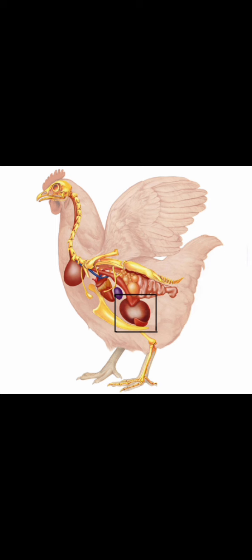I'm saying this because specimen E is intestine from fowl. So we're discussing specimen E now. I said from the gizzard, food passes to the small intestine, where nutrients are absorbed. The residue then will pass through the caeca, which is a blind sac along the lower intestinal tract. This is where bacteria will then help break down the undigested food. Then from there, food will move to the large intestine, which will then absorb the water and dry out food that had not digested.